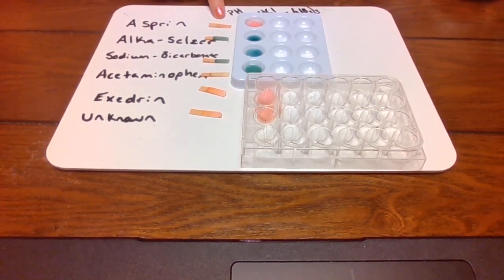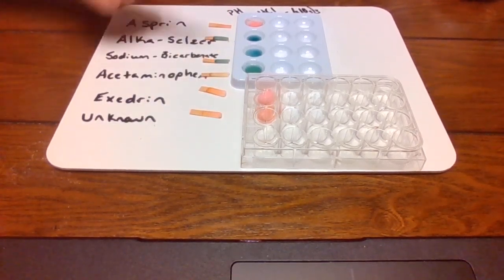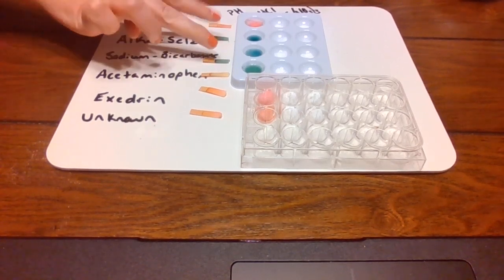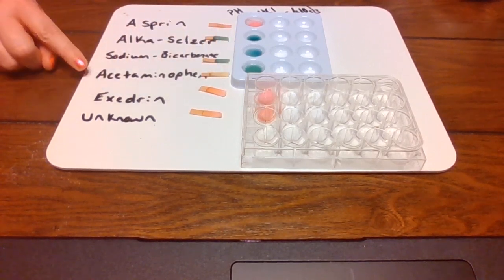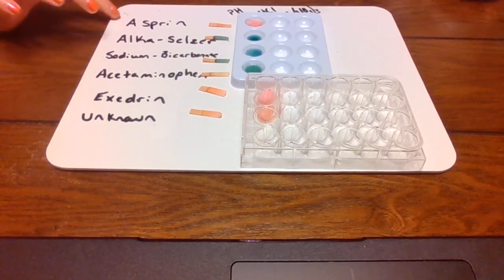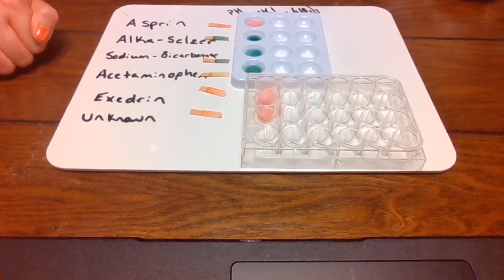The more red or pink it is, the more acidic it is. So we're looking at some acids on the top and the bottom. What is an acid? The bluer it gets, the more basic it is. So basically these two are our most blue, and this is more of a green, acetaminophen. So acetaminophen is the kind of drug you would take for a headache, pain reliever, fever reducer, but it is not as acidic as our other pain relievers and fever reducers. So if you have tummy issues and you have a headache, then you probably don't want to take aspirin or Excedrin because they are very acidic. So just kind of trivia there.